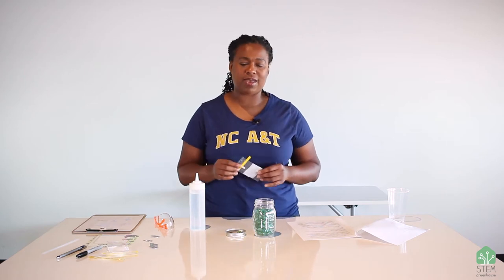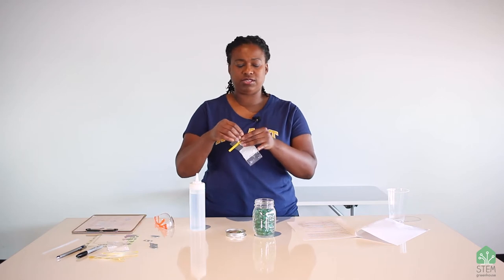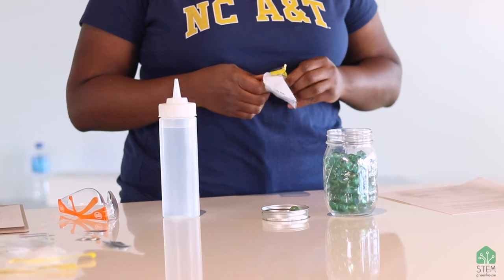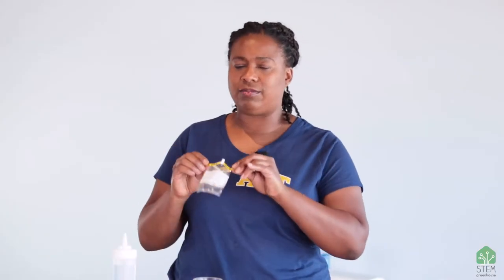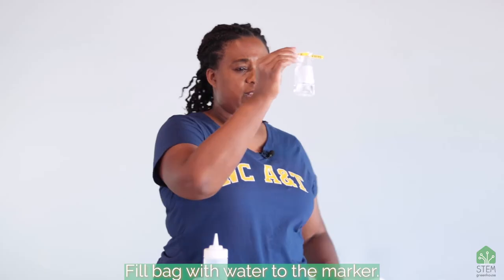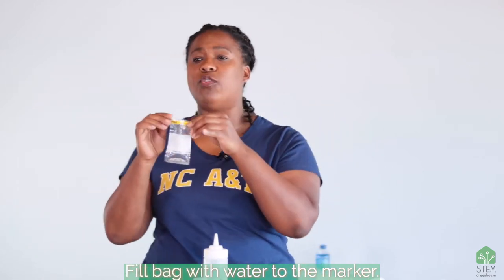Now it's time to do your test. You might want to put the water from your tap into a cup or some type of jar so that you can pour it more easily into the testing bags — it's more difficult to get the sample directly from the sink. In this particular testing kit, the bags have a little perforation at the top that keeps them sealed. You have to remove that first, then open up the bag. The bags have a white strip on them; it's important to put water up to the bottom of the white line. Do not fill it past the bottom of the white line. You might even have to pour some water out if you go over.